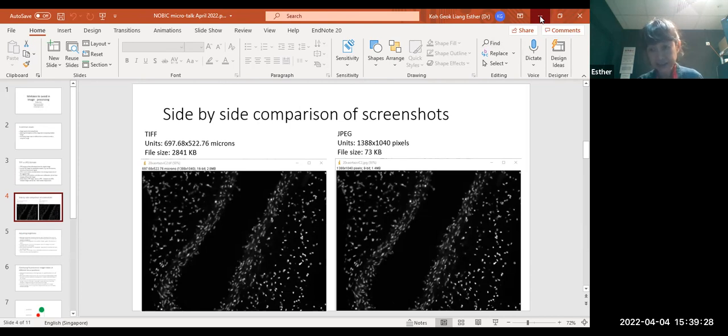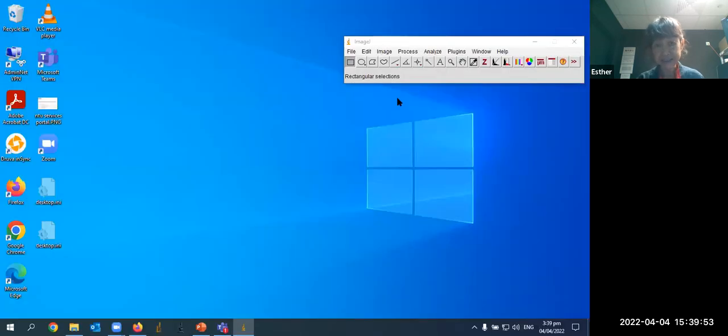Okay, let me move things around. So in ImageJ, I'm going to open a TIFF image. Okay, so you can't see. Let me new share, and yeah, I am sharing my screen. Okay, now can you see my desktop? Yeah, okay, great.